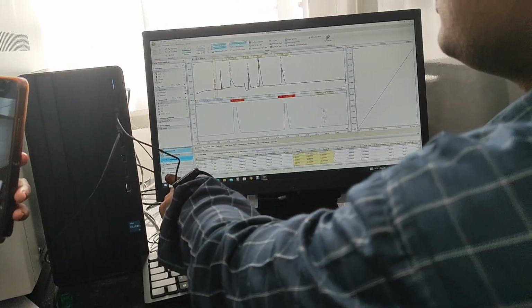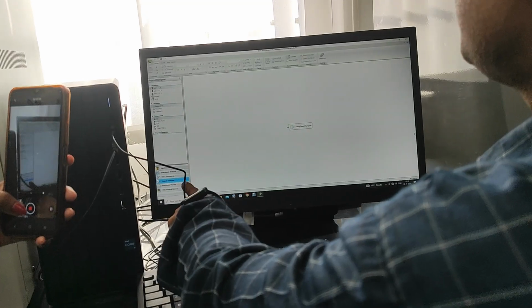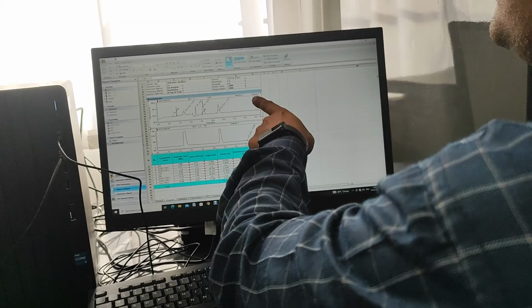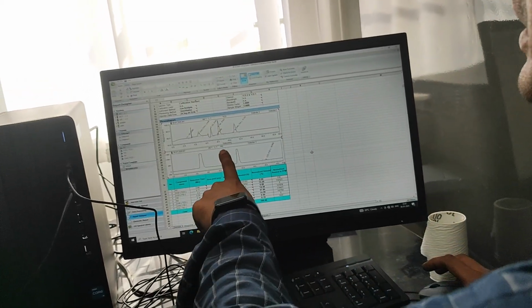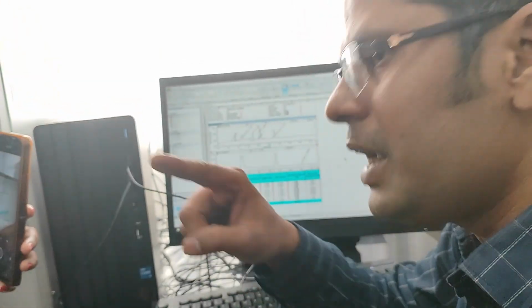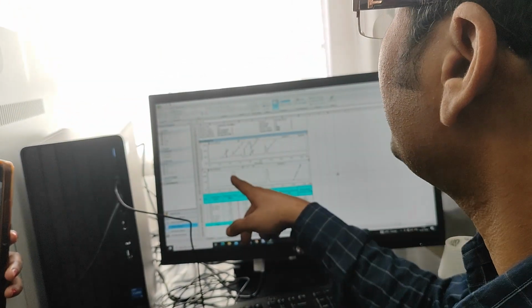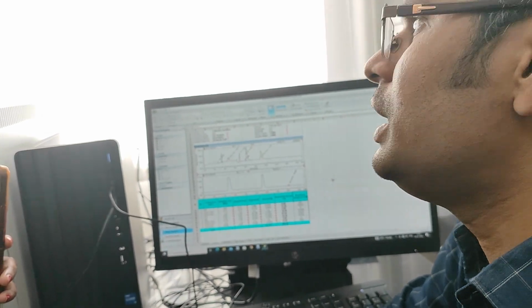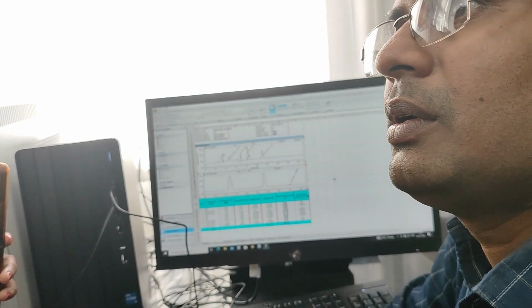So if you go to the report designer, you can see the report will look like this. Two chromatograms, detector TCD, this is FID, these peaks are deleted. In chromatography, deleted means the baseline is deleted, so that area cannot be calculated. Excluded, in chromatography peak deletion means exclusion.